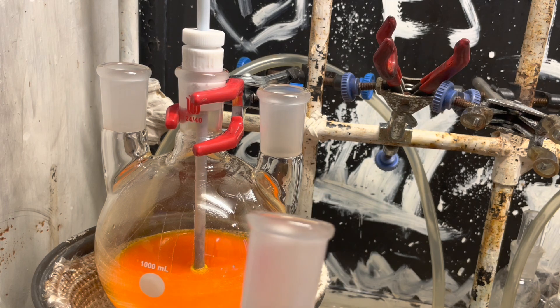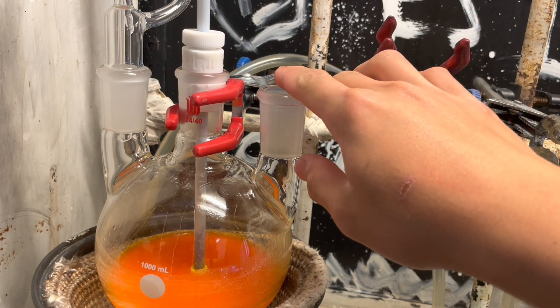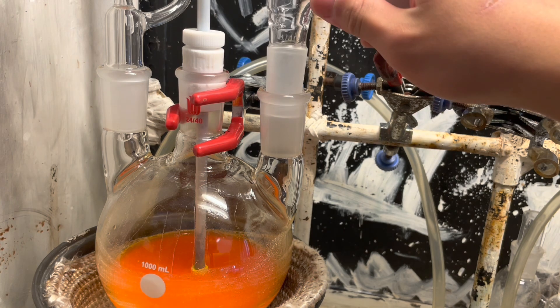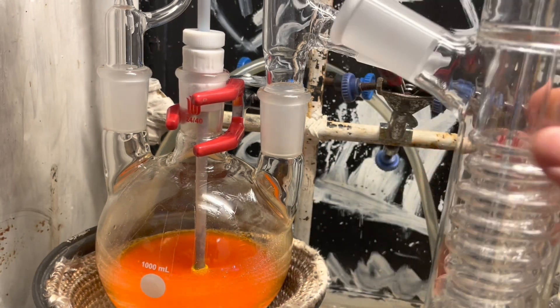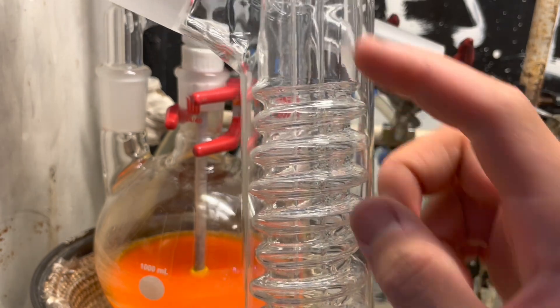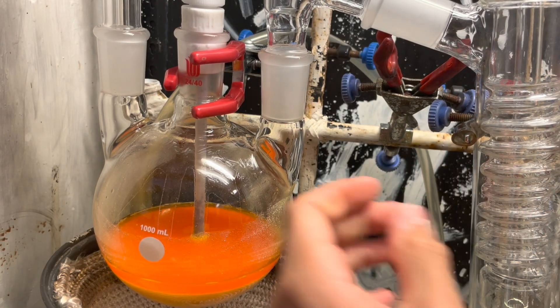Now we take our hydrochloric acid and add it in. The hydrochloric acid goes on the left neck of the flask, and on the right neck I'll set up a distillation apparatus. You can use a Liebig condenser cooled with iced water if you have that. However, I have something better - a Friedrichs condenser. This thing is hyper-efficient; you can see the coils inside are very close to the actual walls, and it's very large like a cold finger, which means it's very efficient at cooling. It would be a good idea to grease the joints with sulfuric acid.